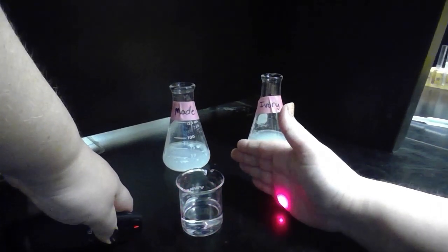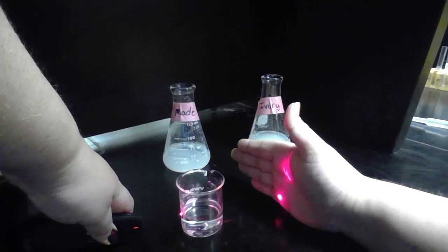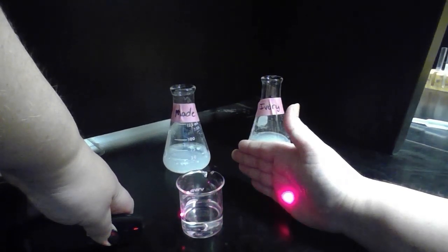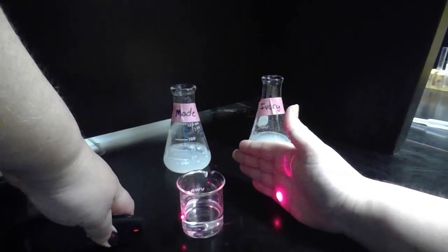And as you can see, it passes directly through. You can see the laser on the other side on my hand very clearly and does not disperse in the solution at all.